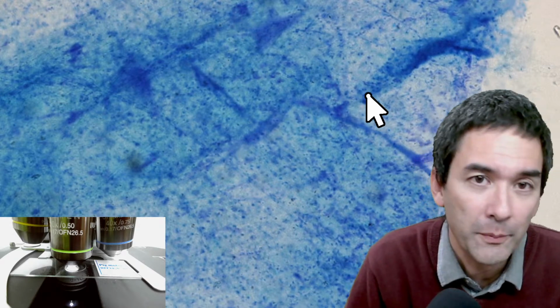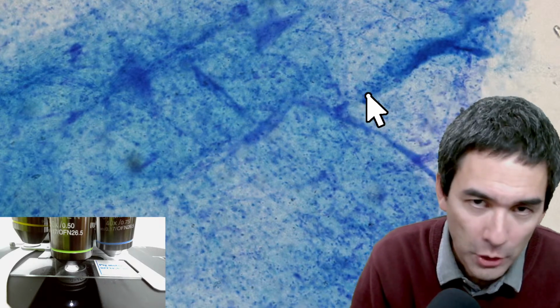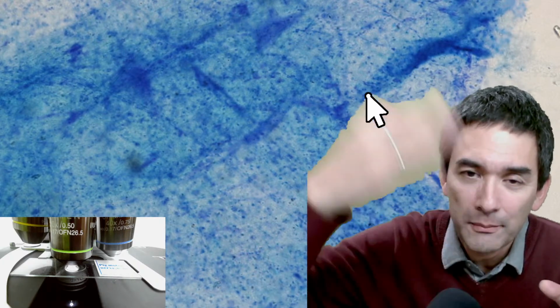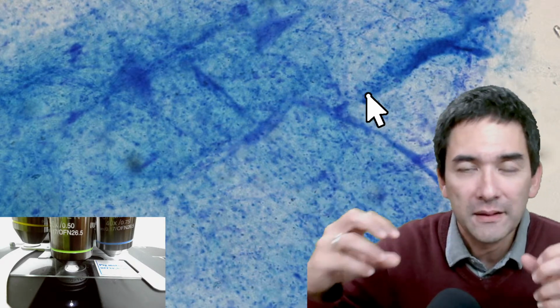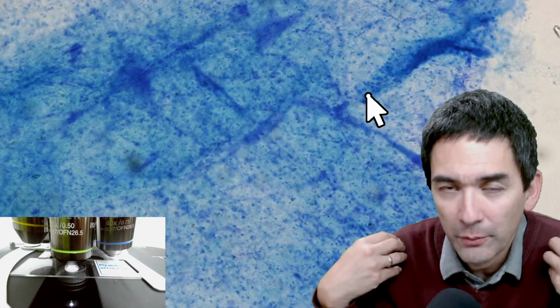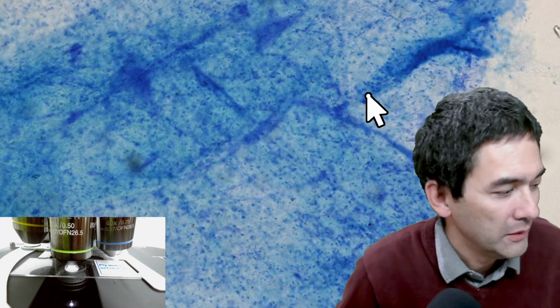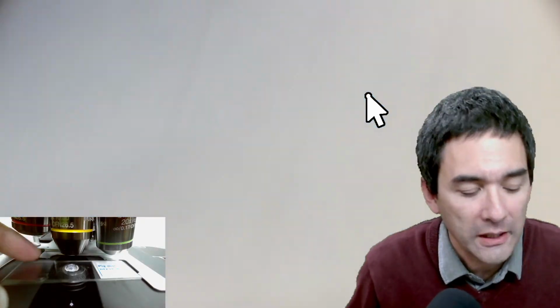So for example, when I look at the blood vessels, the artery and the vein, pretty much all of the slides in the slide boxes look the same because they're from the same series and they're just cut with a microtome, and so basically the slides are all very similar. Yeah, and this makes it kind of easier. So if you need them for education, I would not buy antique slides because it would be kind of a pity to use them with students, and I need more of them. And so I would say it depends a little bit what the objective and the purpose is.